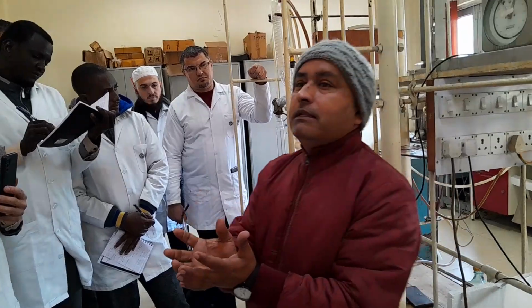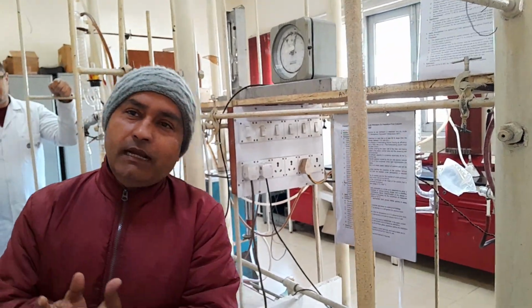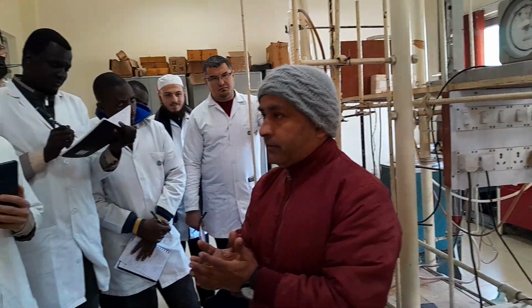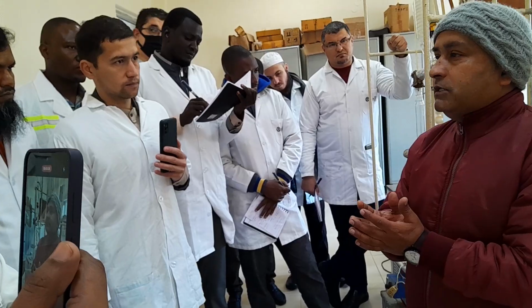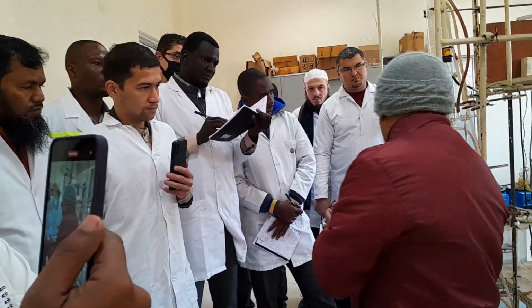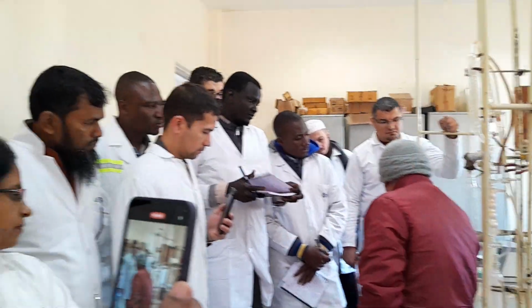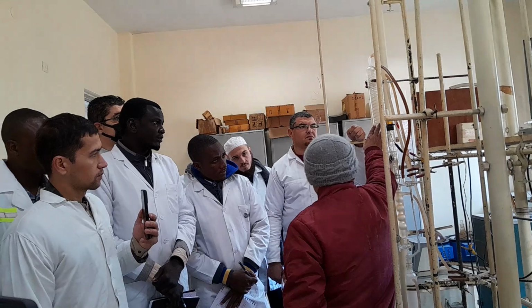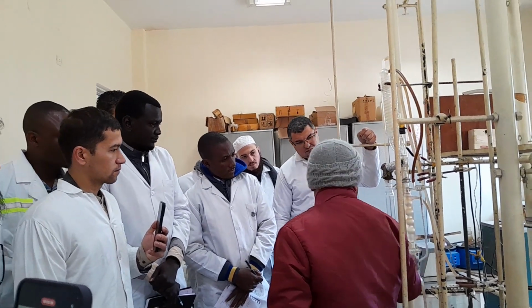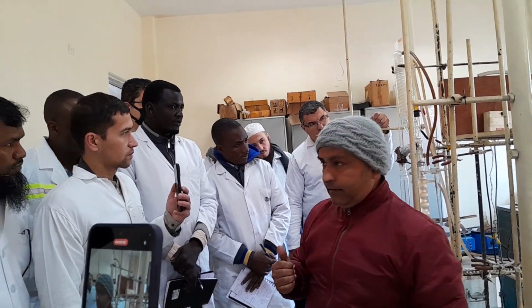But before taking the crude sample, it has to be kept inside the freezer at 0 degrees centigrade for at least 1 hour, so that there are no losses of lighter hydrocarbons like C1 to C4 or C5. Okay, so after doing all these things, now I will put this, my hollow column, and this is my condenser, this is the fraction cutter, and this is the receiver, and this part is known as the reflux head.